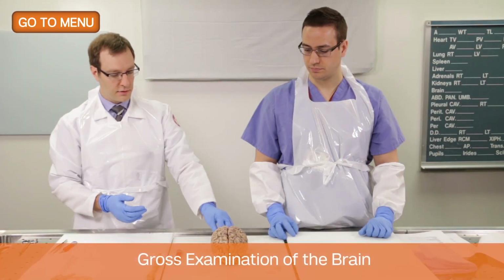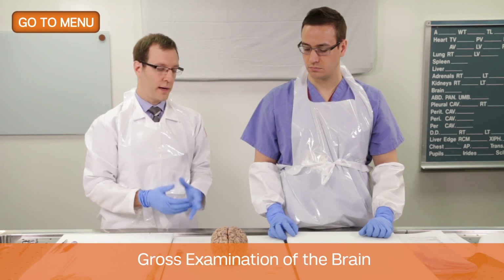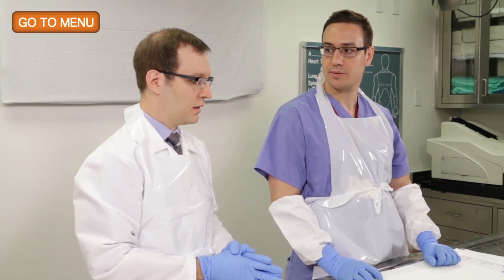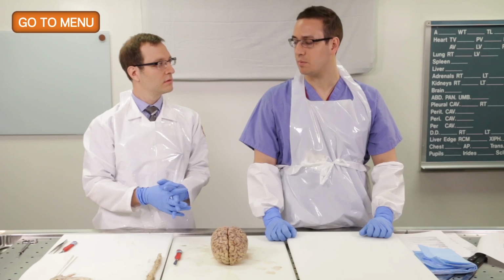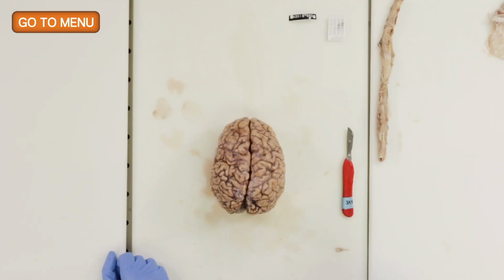The first thing we want to do is analyze the exterior surface of the brain. Typically, we'll weigh the brain before we fix it. Do you know the weight of this brain? Yes, it was 1,200 grams. So 1,200 grams for a 47-year-old, is that normal? That's about normal for that age and for that gender.